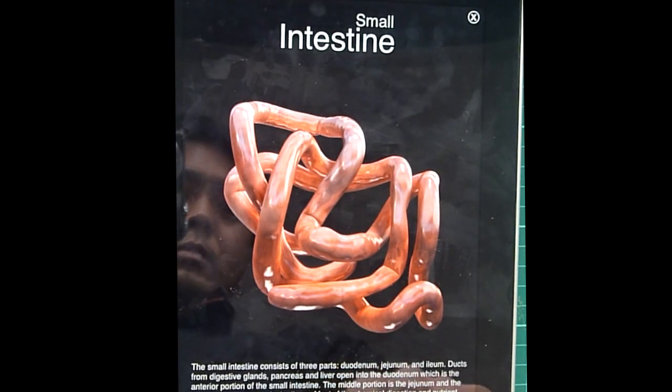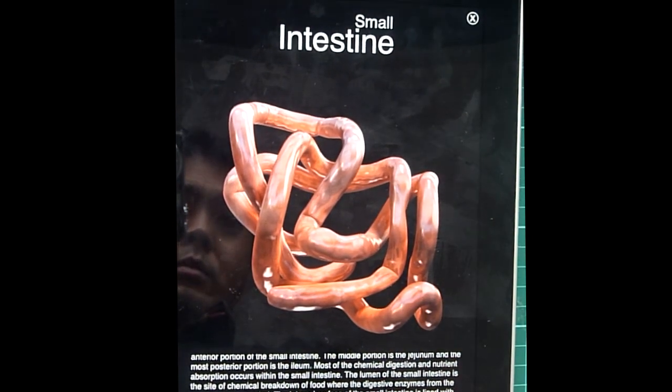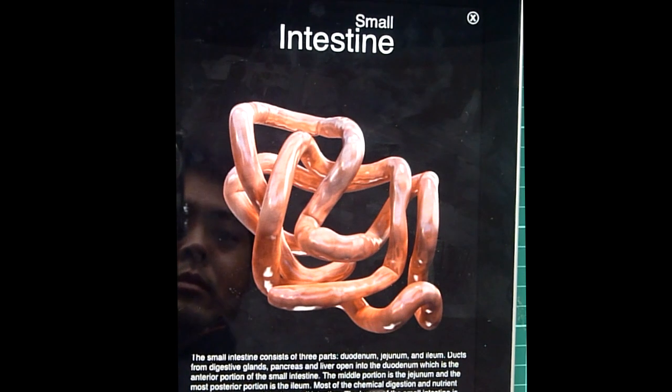The small intestine consists of 3 parts: duodenum, jejunum, and ileum. Ducts from digestive glands, pancreas, and liver open into the duodenum, which is the anterior portion of the small intestine. The middle portion is the jejunum, and the most posterior portion is the ileum. Most of the chemical digestion and nutrient absorption occurs within the small intestine.